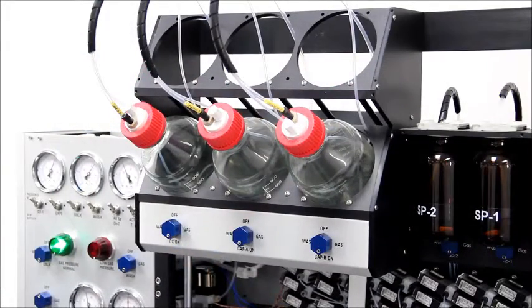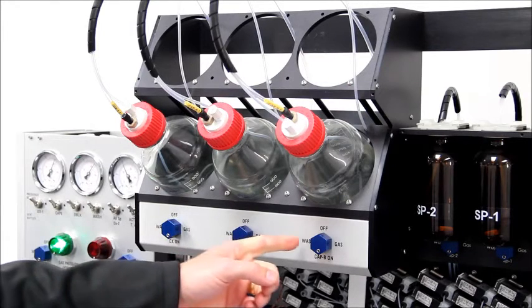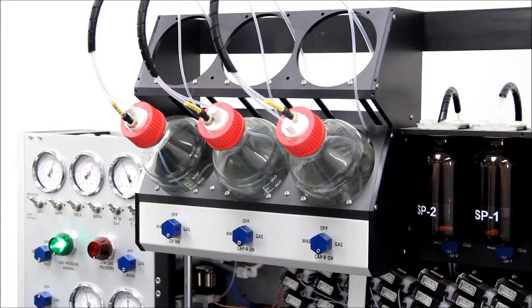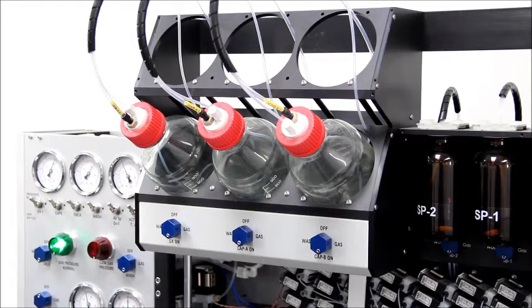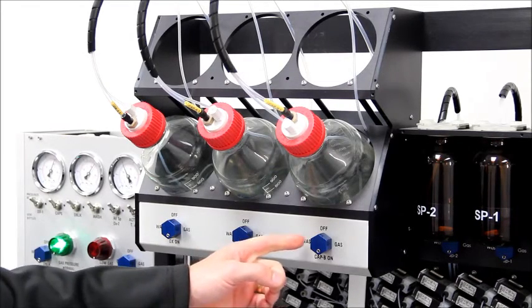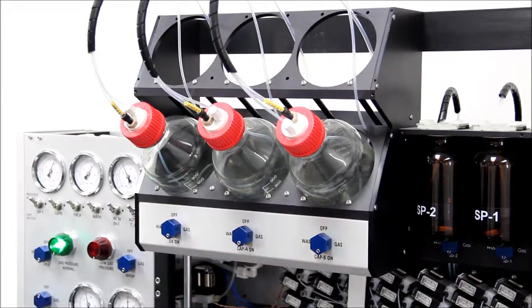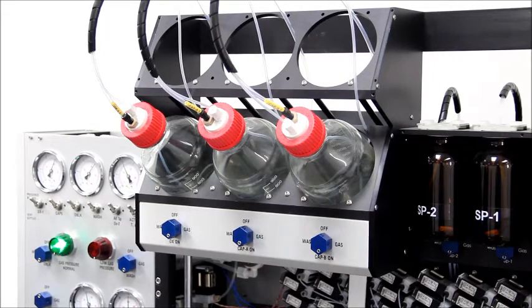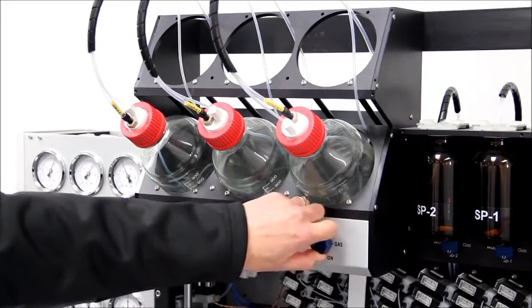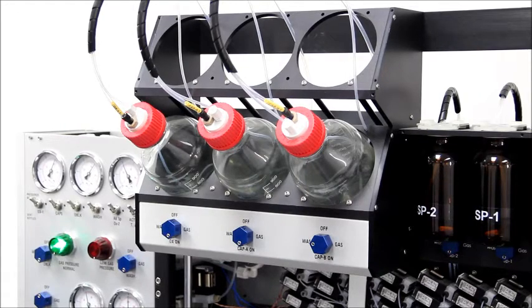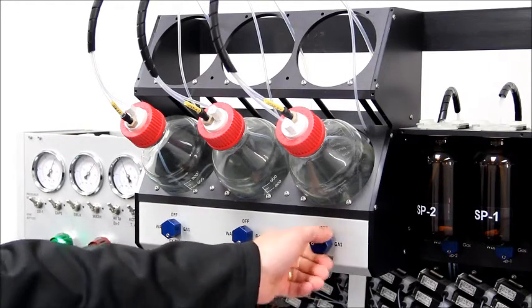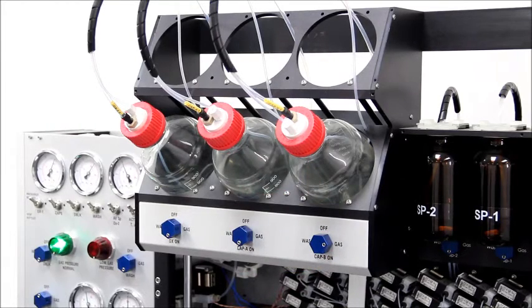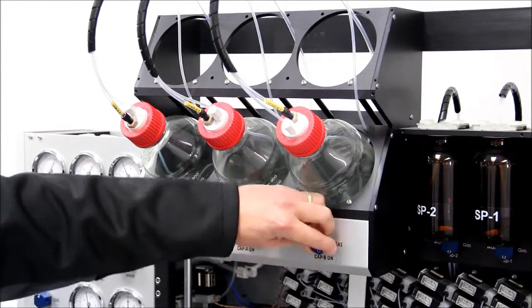Each reagent position is equipped with a manual valve that controls what is delivered to the reagent nozzles. During synthesis, the valve is set to the reagent itself. However, after a synthesis run is complete, the valve can be switched to wash to rinse the lines and nozzles with acetonitrile, and then to gas to blow gas through the lines before re-priming them with the reagent.